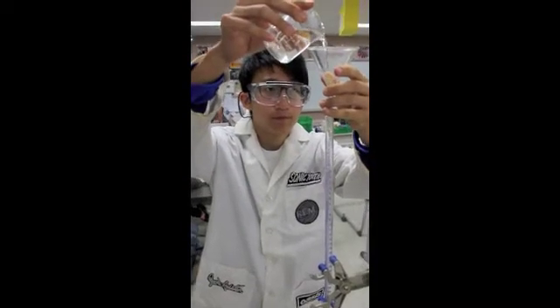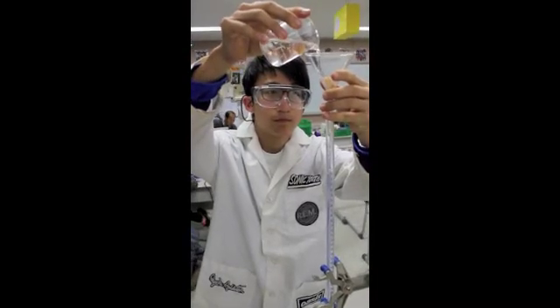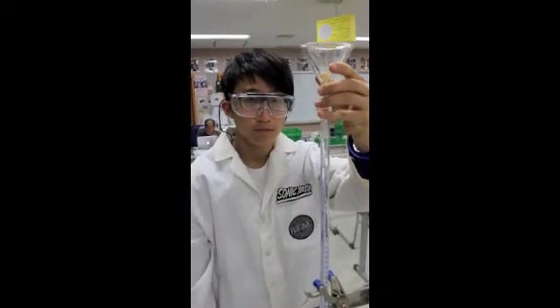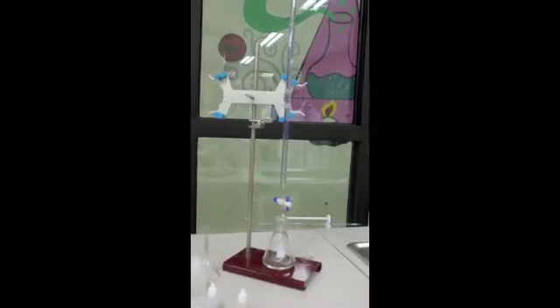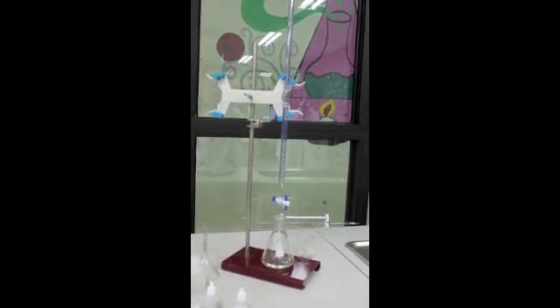You will most likely need a funnel to insert the titrant. You may need to lift the funnel slightly to make sure the solution flows in fluently with the burette. First, make sure that the burette is clean with no water, as it could change the concentration of the titrant.